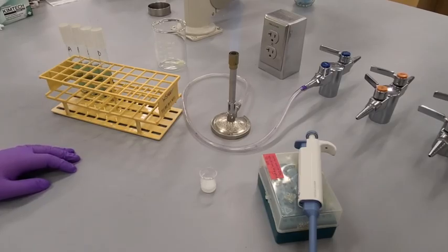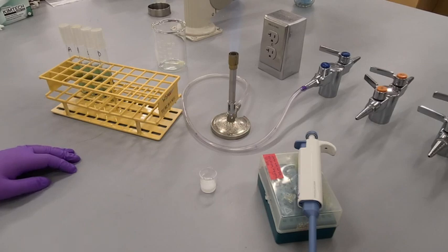In this video we will be looking at the Snyder test which is used to determine someone's susceptibility to dental caries using their saliva and the Snyder media.